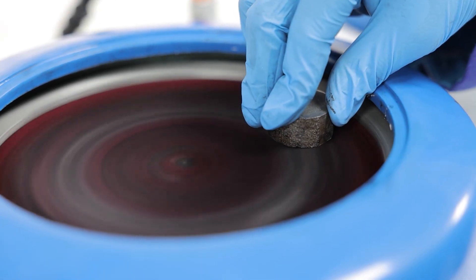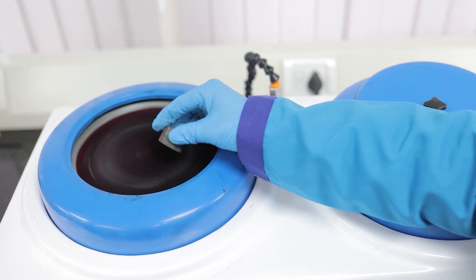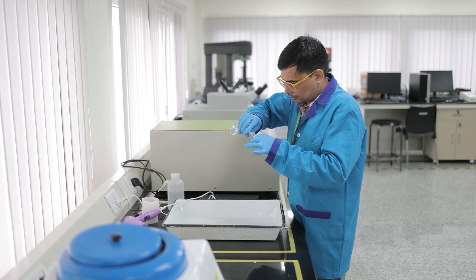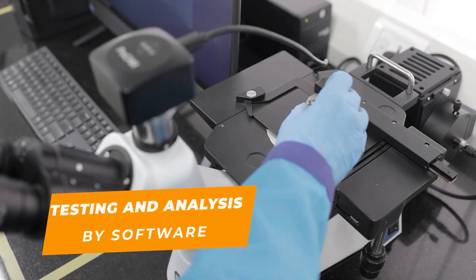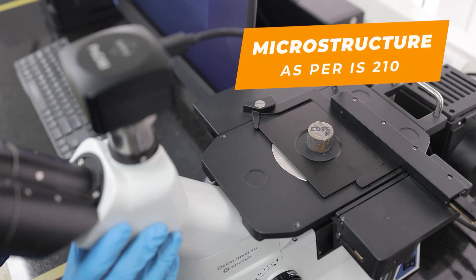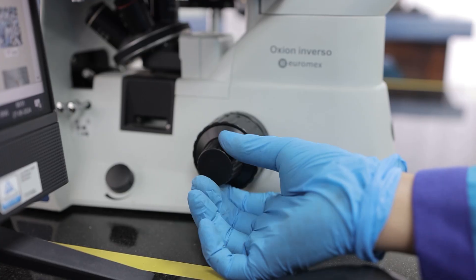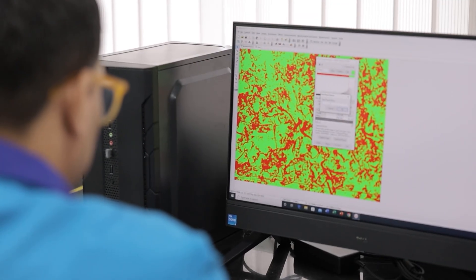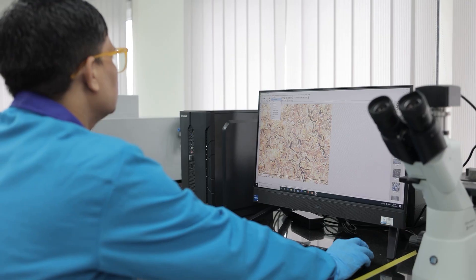Polishing removes scratches from the grinding process and produces a mirror-like surface. It is done with increasingly fine diamond paste or polishing cloths to achieve a smooth finish on a double-disc grinder. Etching involves treating the polished sample with a chemical reagent solution to reveal the microstructure. Different etching solutions highlight various structural features such as grain boundaries, phases and inclusions. After preparing the sample, it is positioned on the viewing platform of an inverted metallurgical microscope. The magnification is adjusted, and the microscope's built-in camera captures the microstructure image, which is analyzed using specialized software that enables direct calculation of the amounts of ferrite and pearlite present, as required by Clause 9 of IS-210.